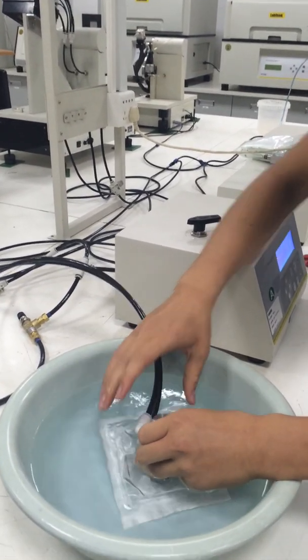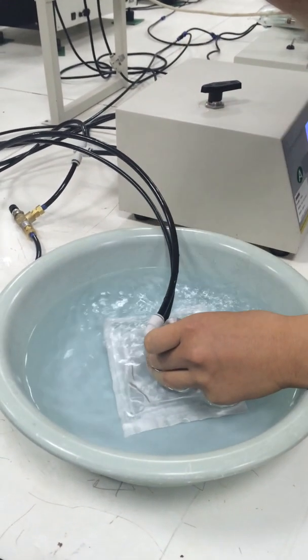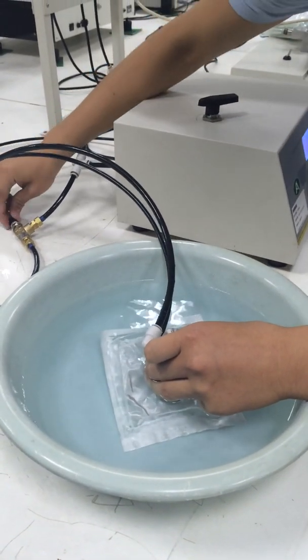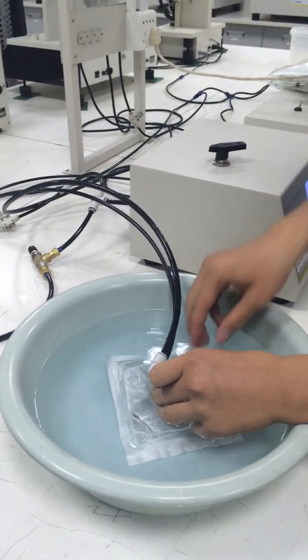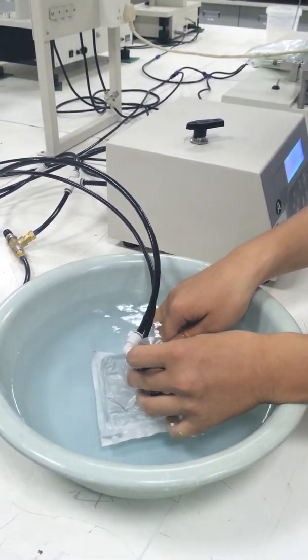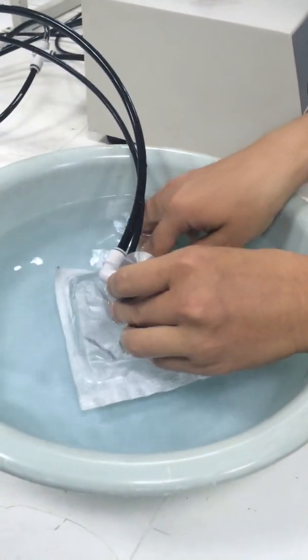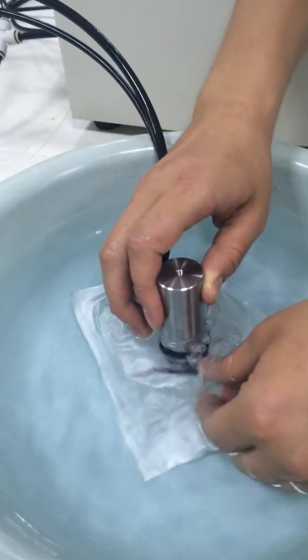Now the pressure is increasing. You will need to adjust the flow rate once, and after that it's okay—we don't need to adjust it again. Here I didn't seal the specimen well.